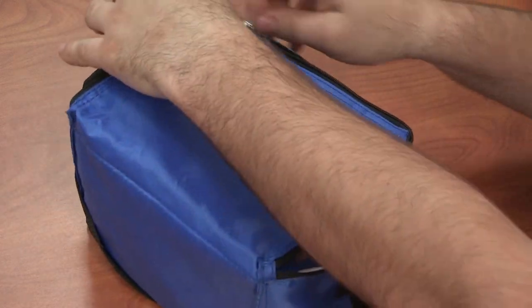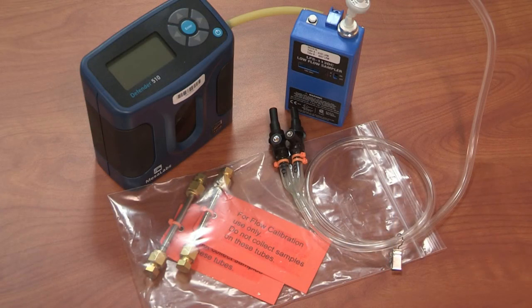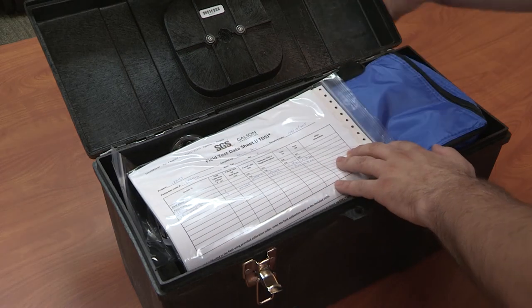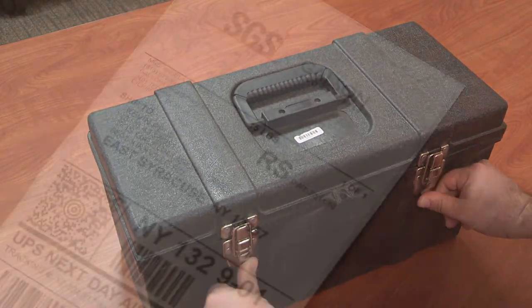Samples must be kept refrigerated at four degrees Celsius if unable to ship back to SGS Galson immediately. When shipping back, please use the provided ice pack and cooler. For kits with the optional low flow calibrator, perform your post-calibration now using your calibration tubes. Document the sampled flow rate on your field test data sheet.